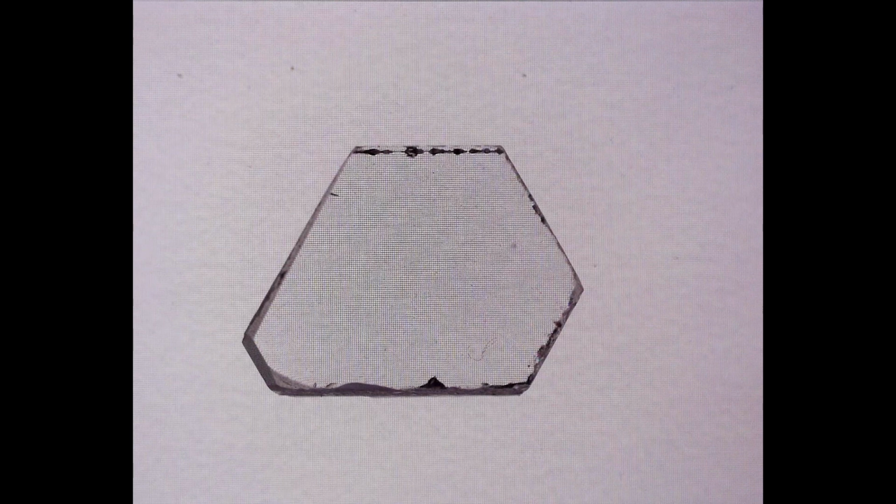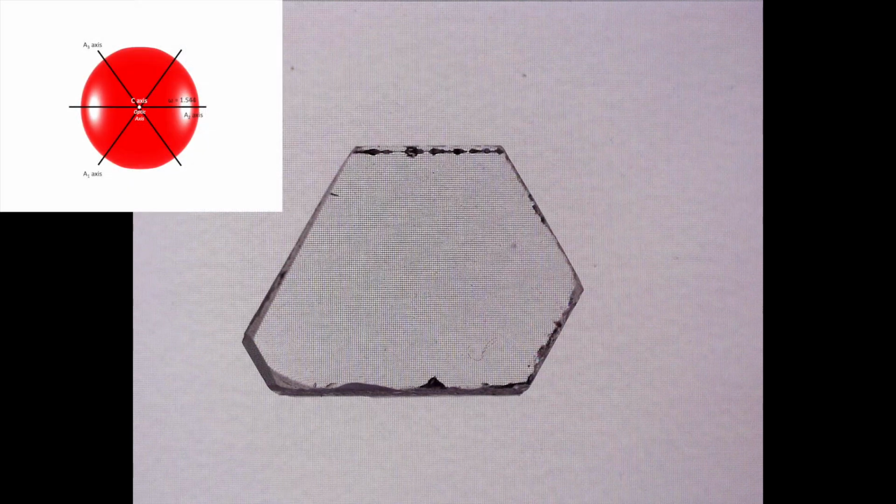And that also means we're looking at this view of our optical indicatrix for quartz. And in this view, we're only going to see light that interacts with refractive index omega. I should also mention with my current polariscope setup, our plane polarized light is vibrating in a north-south direction. So with our polariscope in this configuration, the phenomenon we'd be looking for in plane polarized light is pleochroism.